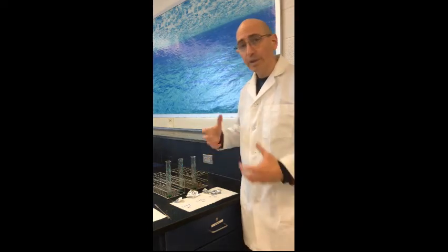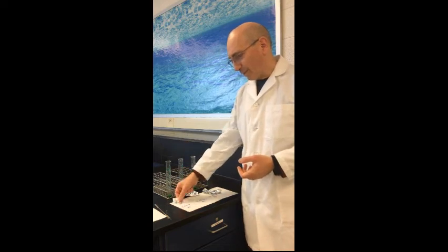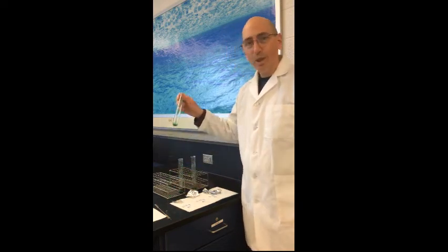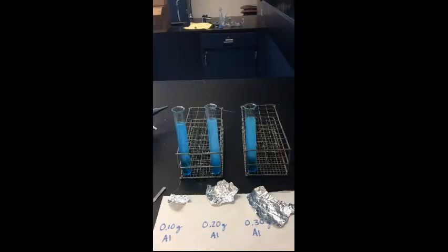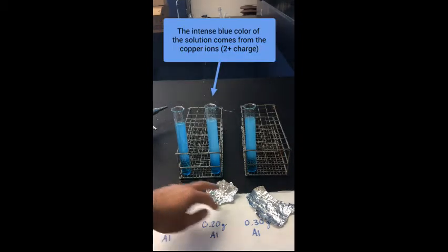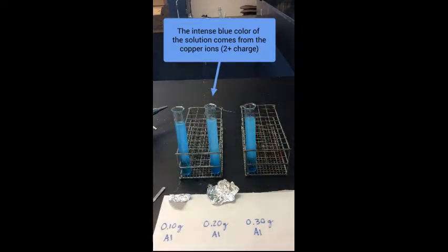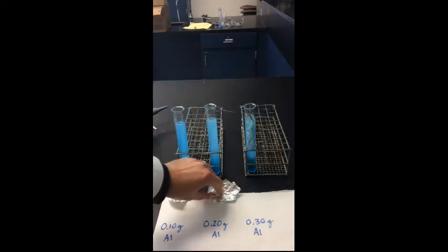Okay, so we have all these things we know. We're going to start with the given, which is the mass of the aluminum, and we're going to end up with the mass of copper 2 chloride. So now we have our 3 test tubes. They each have the same amount of copper 2 chloride. We added water to make a solution, and what we're going to do is take this aluminum foil. Again, we have 3 different masses of aluminum foil, and we're going to introduce the aluminum foil into each test tube.